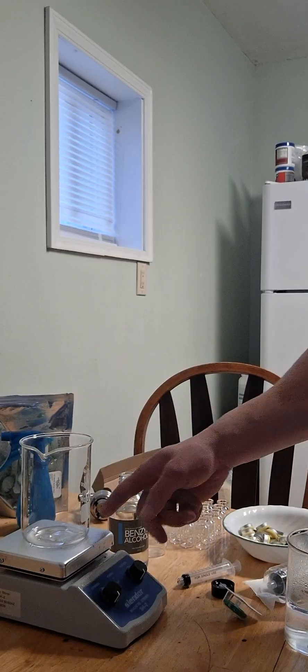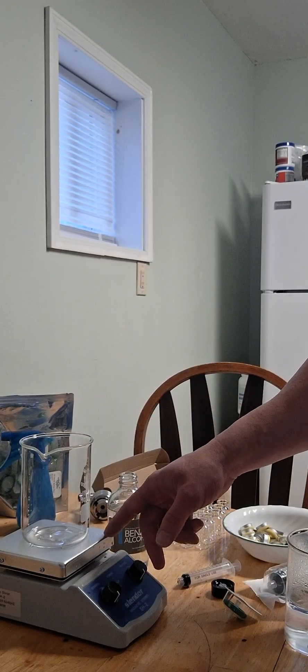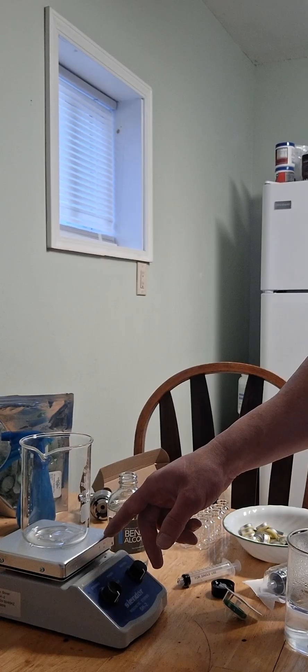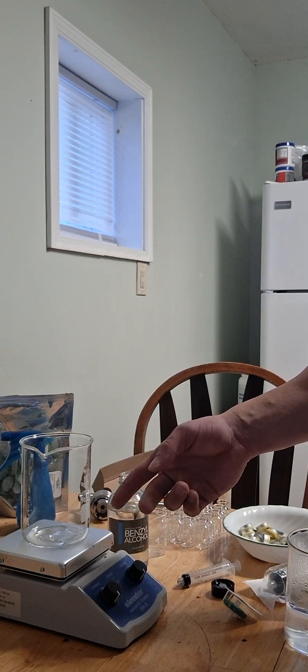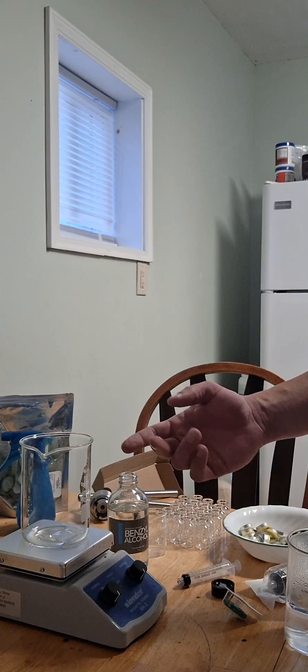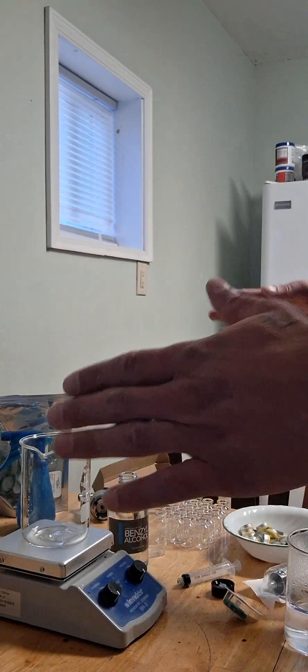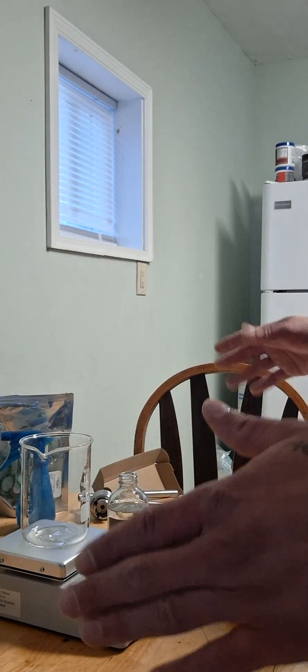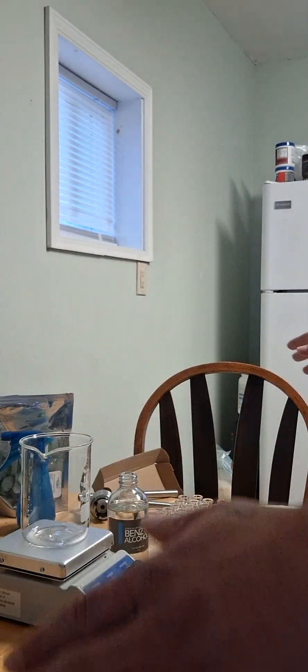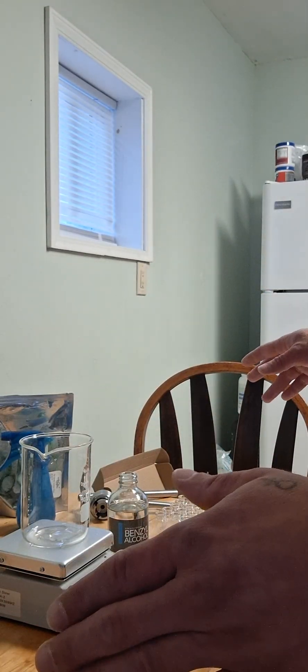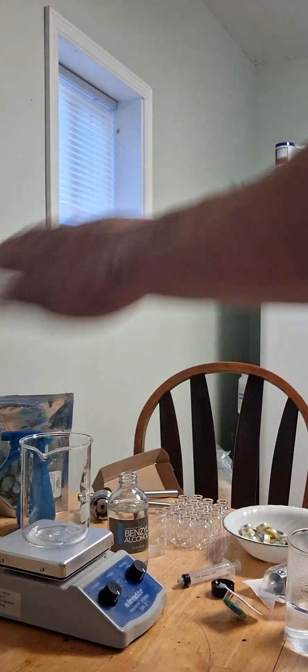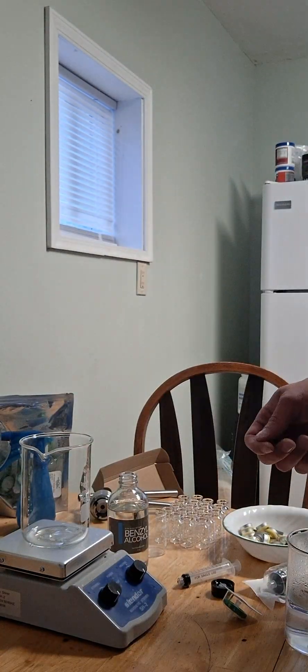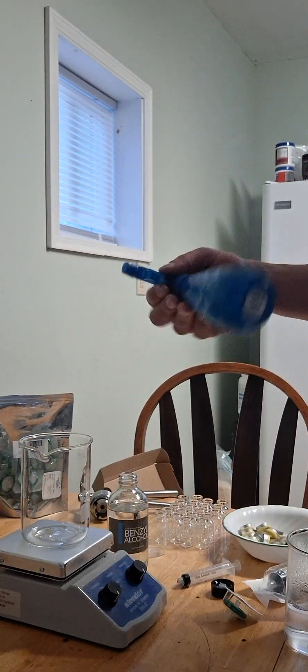Also, you don't need like beakers and all that. I just have all this stuff. You also don't need a magnetic stirrer; you can use a sterilized fork, but I had this for other products that I make, so it just makes my life easier. You want to sterilize everything. I just use Lysol, just sterilize your working area. I like to take a shower beforehand.